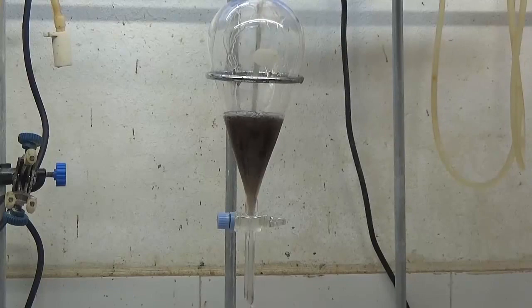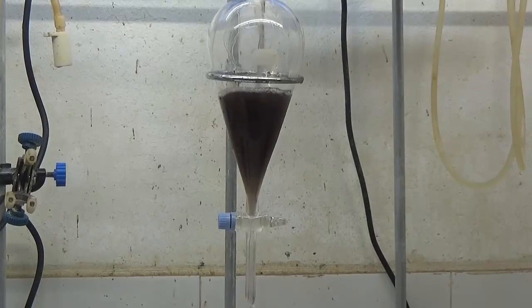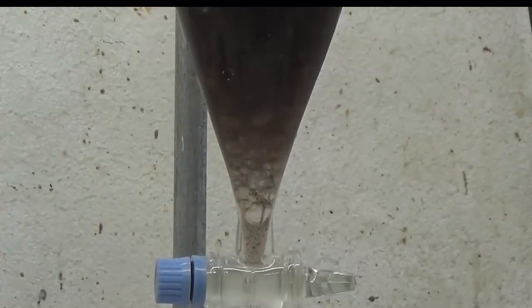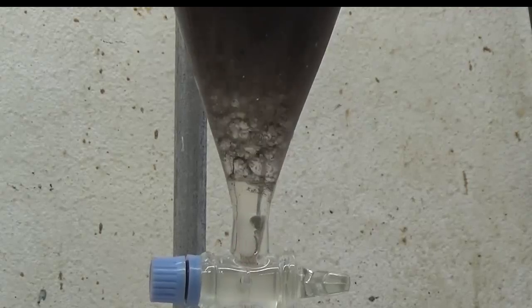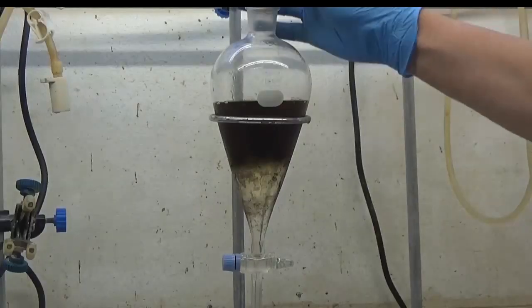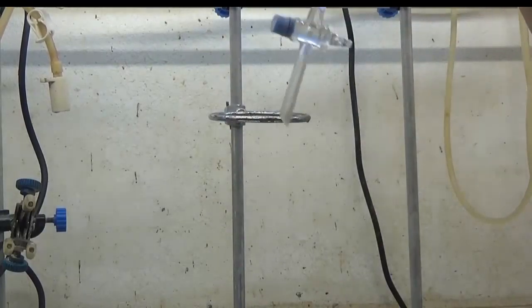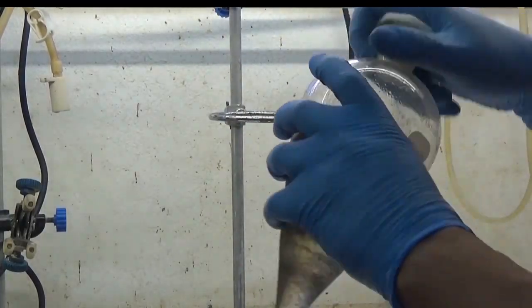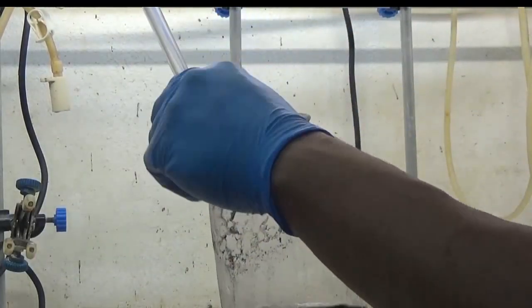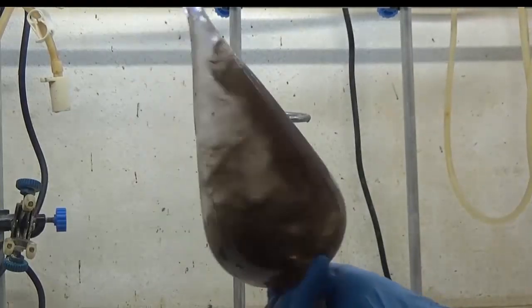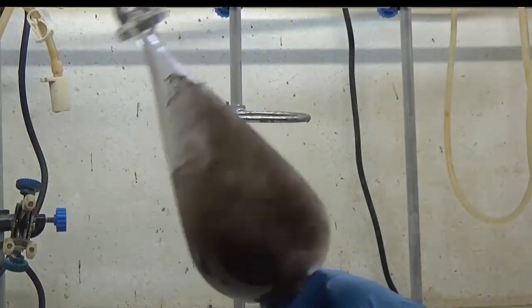Double extract with 50 milliliters of dichloromethane per 200 milliliters of distillate. Dichloromethane is very toxic when inhaled. It is recommended to work under hood or outside.